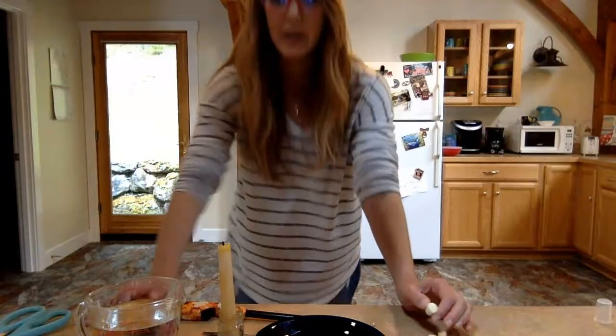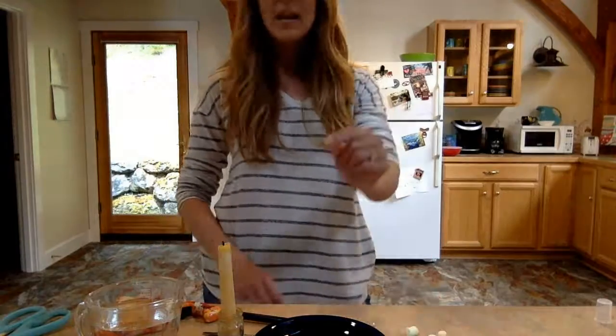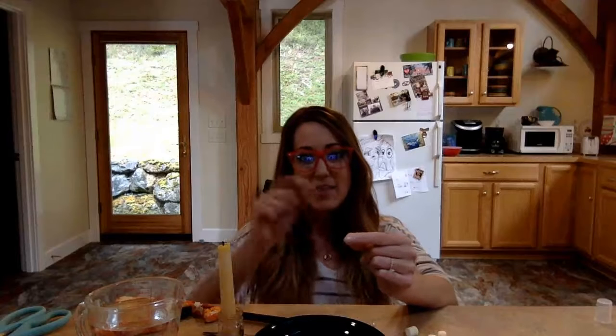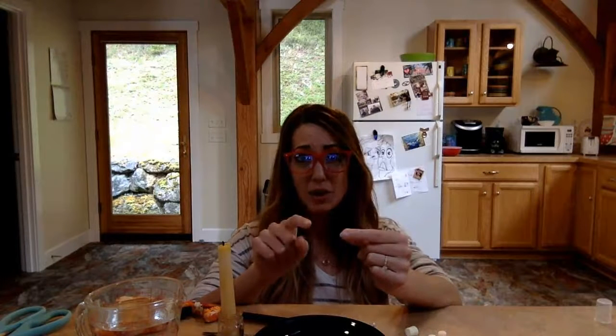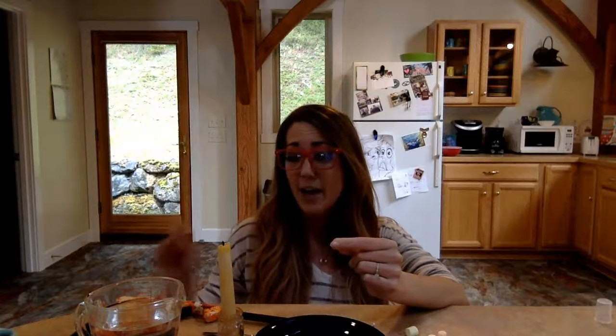Because what's going to happen is we are going to set them on fire, and the minute that it holds the flame for itself, we start the stopwatch. And then the minute the flame goes out on our food item, we stop the stopwatch. Okay, so we're keeping track of these times. So scratch paper or in your science notebook, be keeping track of your predictions for each of your items and your time. Okay, so pause the video, make those predictions.